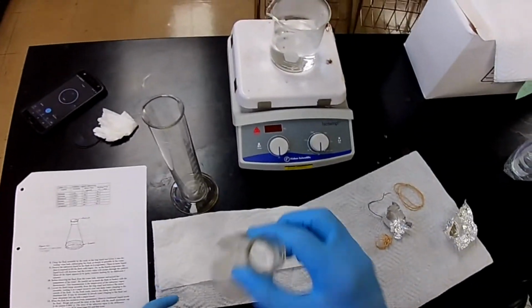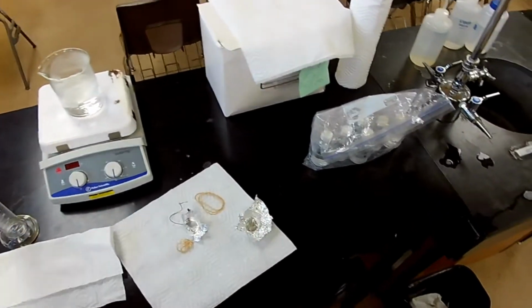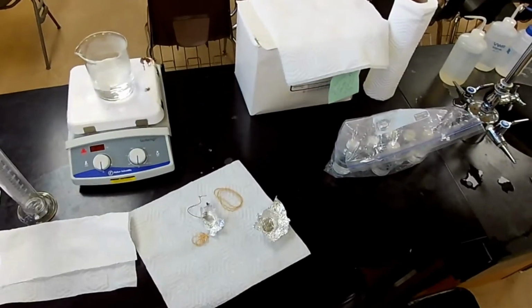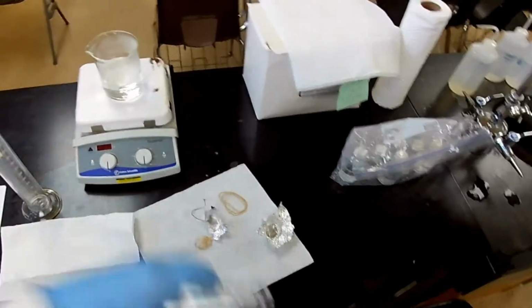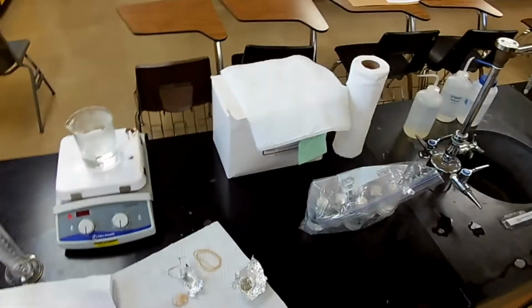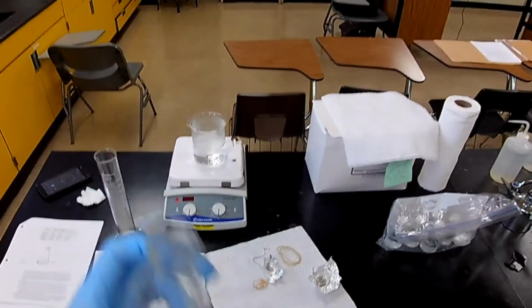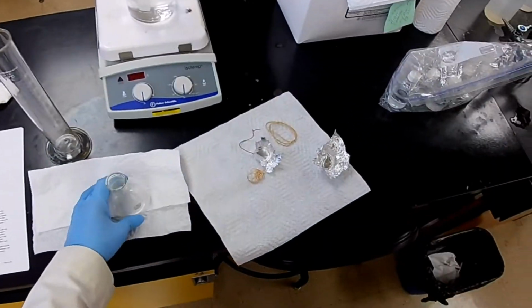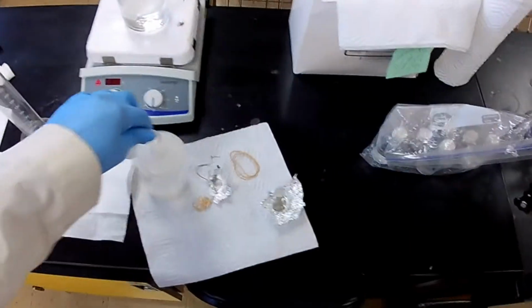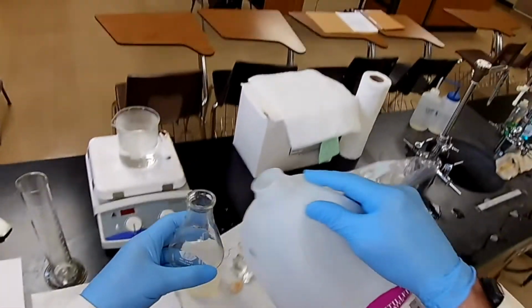All right. Yeah, I still smell something. I'm not going to tell you what I smell because that'd give it away. Because these volatile compounds have a distinct odor. And several of them you can identify by smell. That's good. Now, let's bulk fill it and then top it off with our wash bottle.